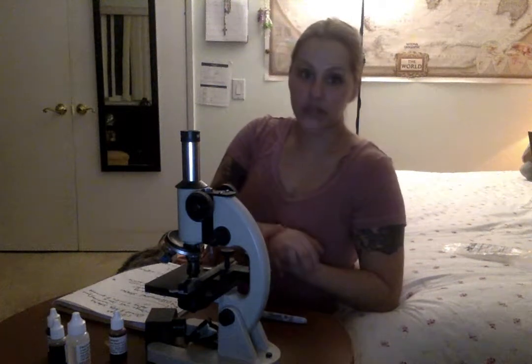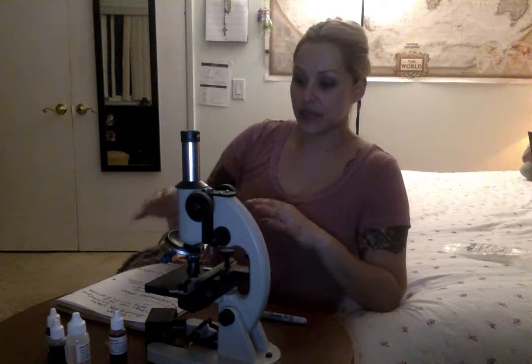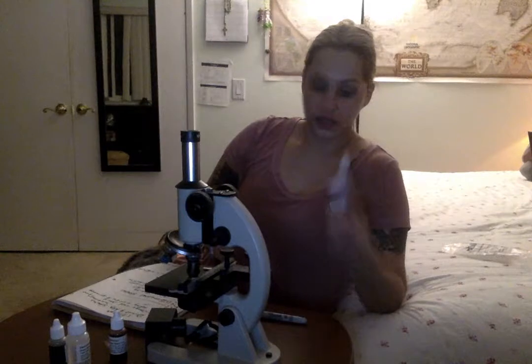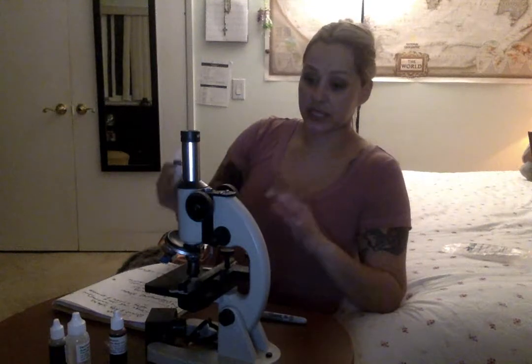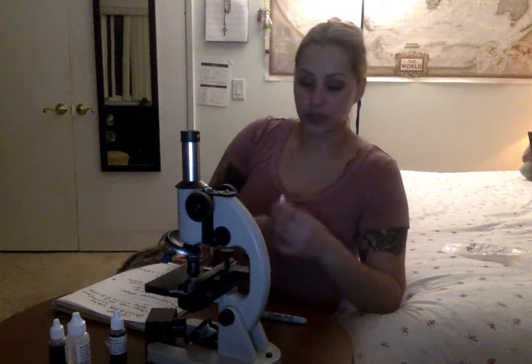The second part of the lab was the differential stains, which had to do with the gram staining technique, and that required a process of four stains, including the crystal violet one, of course, which was the first one. So that's this one. We first take the three cultured broths that we have, smear those onto the slides, and do the gram staining technique on all three of them and view the different cells and microorganisms within each of those different cultures.